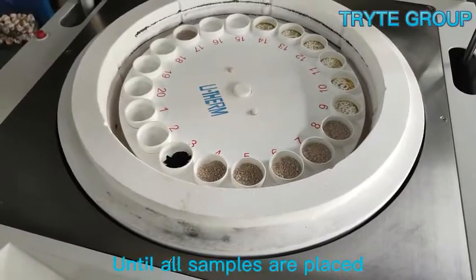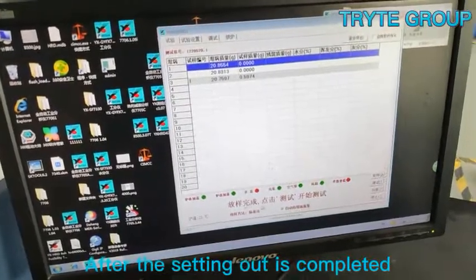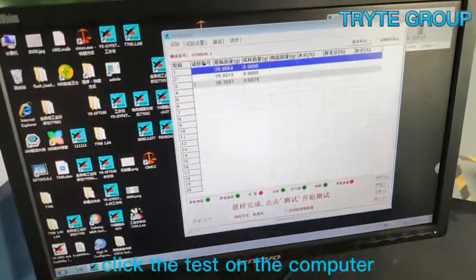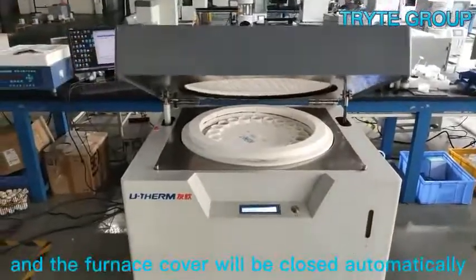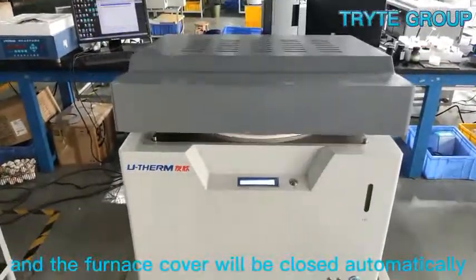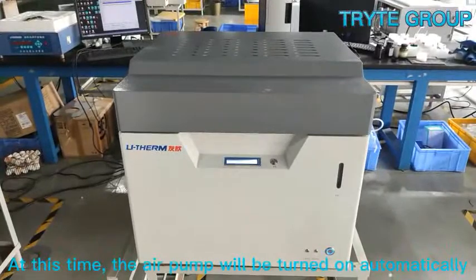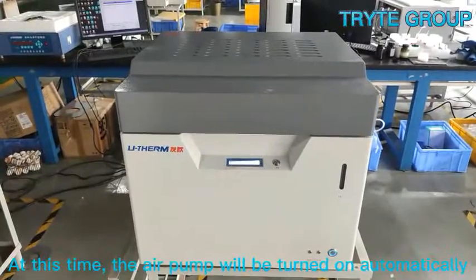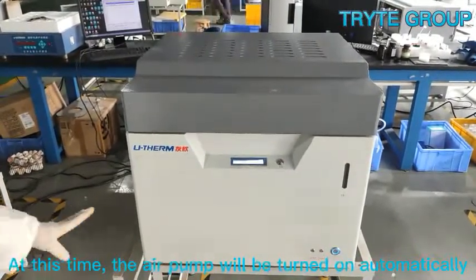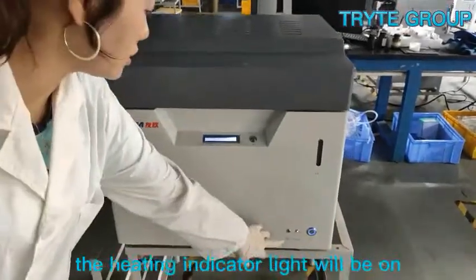Press the sample weighing button to confirm, and the sample tray rises and rotates to the next crucible until all samples are placed. After the setting out is completed, click test on the computer and the furnace cover will close automatically. At this time, the air pump will be turned on automatically.